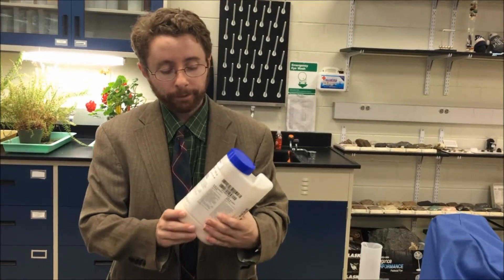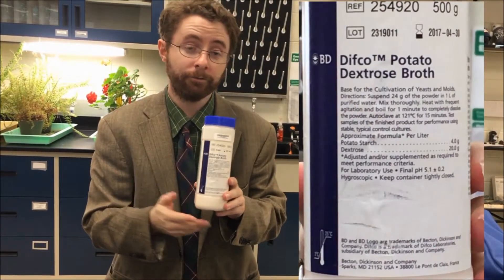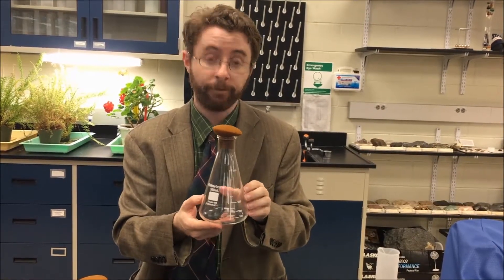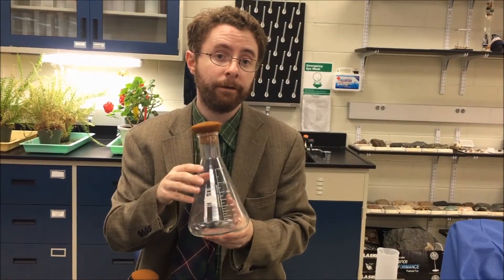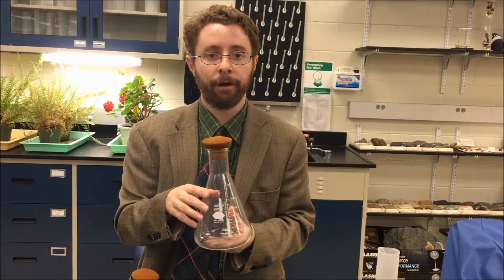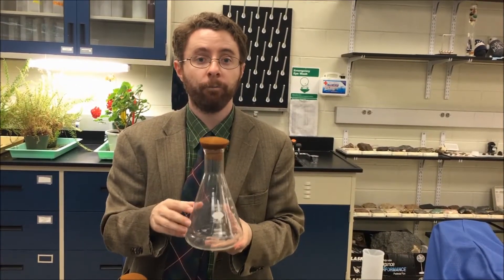So now we're going to take a look at how we can prepare growth media. Most media come commercially available in a dehydrated form, so you simply add water to your flask. You also need to consider what flask to use. If I want to prepare 200 mils of media, I'll use a flask that is 500 mils in total volume. If I want to prepare 500 mils of media, I'll use a 1 liter flask. And if I want to prepare 1 liter of media, I'll use a 2 liter flask. We do this to make sure that there's no boil-over occurring when we sterilize our media.